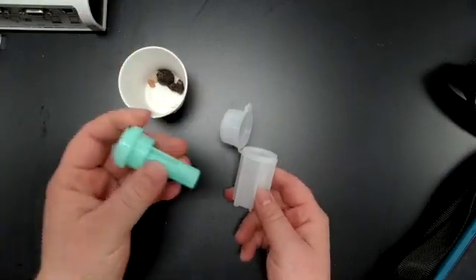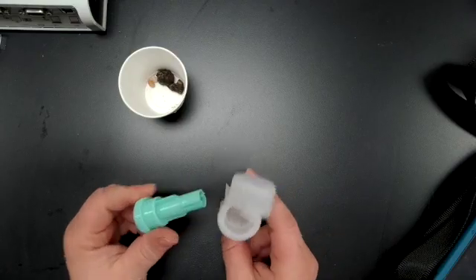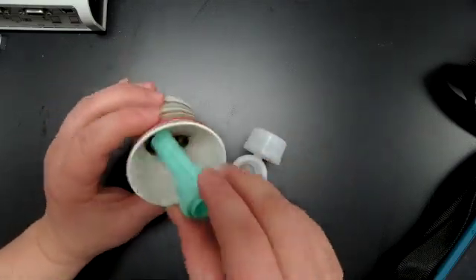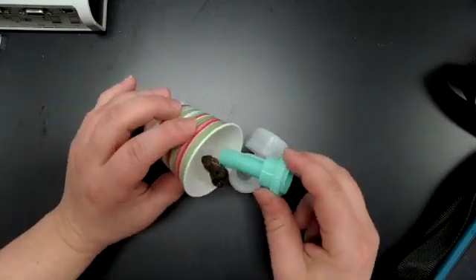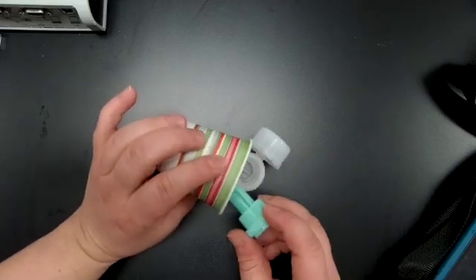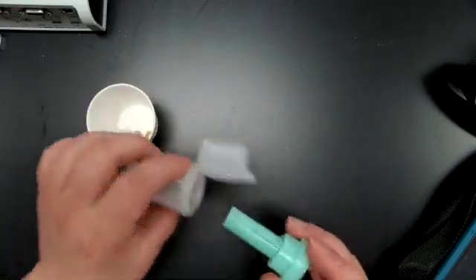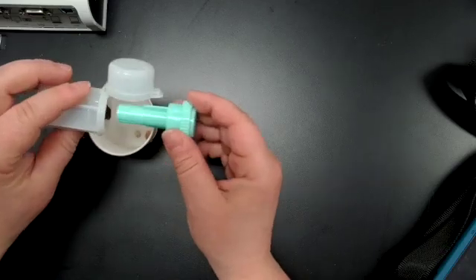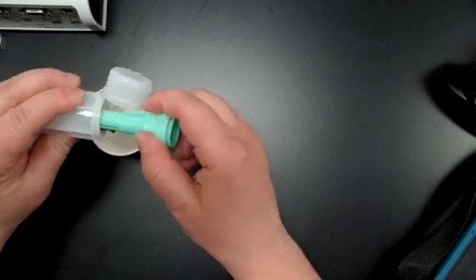We are going to use the fecalizer method. I have a plastic fecalizer here. I'm going to take my feces, put it into my fecalizer. That is a bit much, so I'm going to break off a little bit.